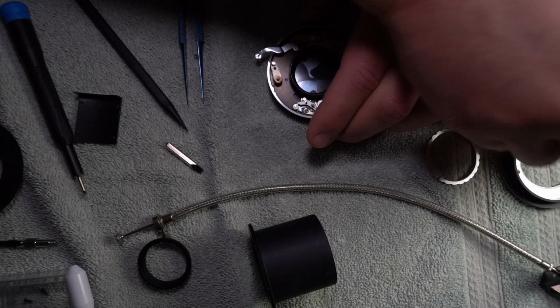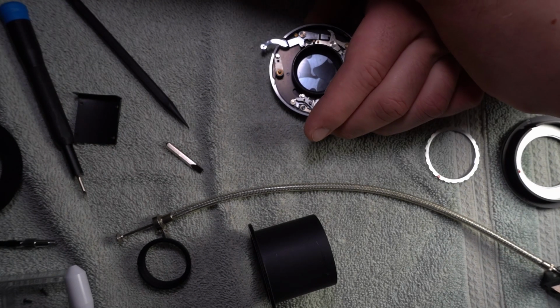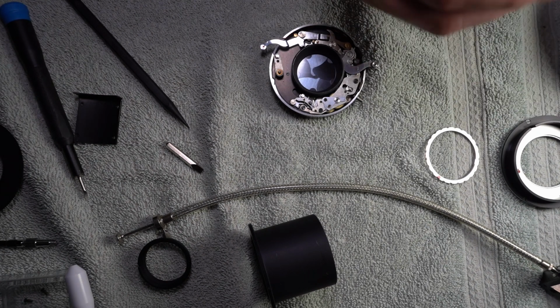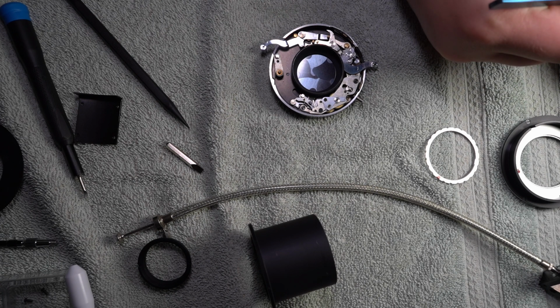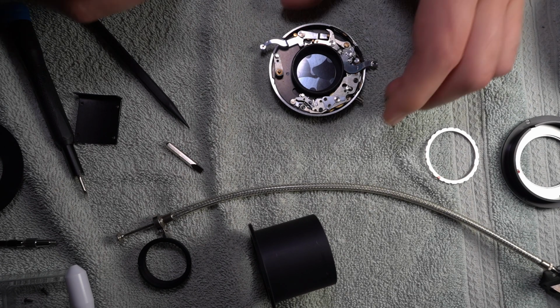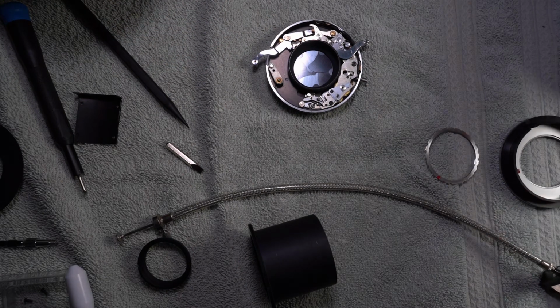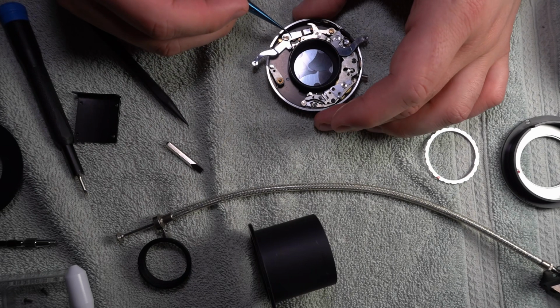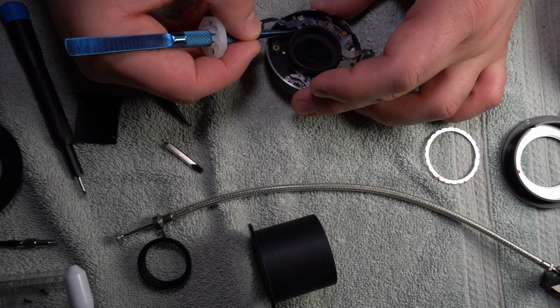And I don't expect you guys to be able to really see what's going on here, but in fact, I'm going to end up using this thing, I think. Okay. Where's that part? There it is. I got this thing for storing this. I'm going to put that on there so I don't have to... These are tweezers and they want to open up, so I'm going to unopen them. Get in here.